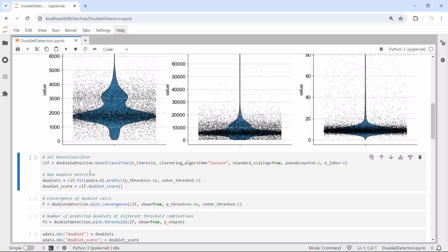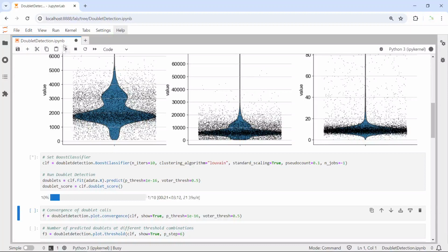So first, we need to set the boost classifier for doublet detection. You can see we can set the n iterations as 10, clustering algorithm as louvain, and we have other parameters here. Then we will run doublet detection using the doublet detection Python package. So we will get the data for doublet and the doublet score. So now we can run the doublet detection. Okay, it is done. You can see it takes 1 minute and 15 seconds to run the doublet detection. So next we can look at the data.